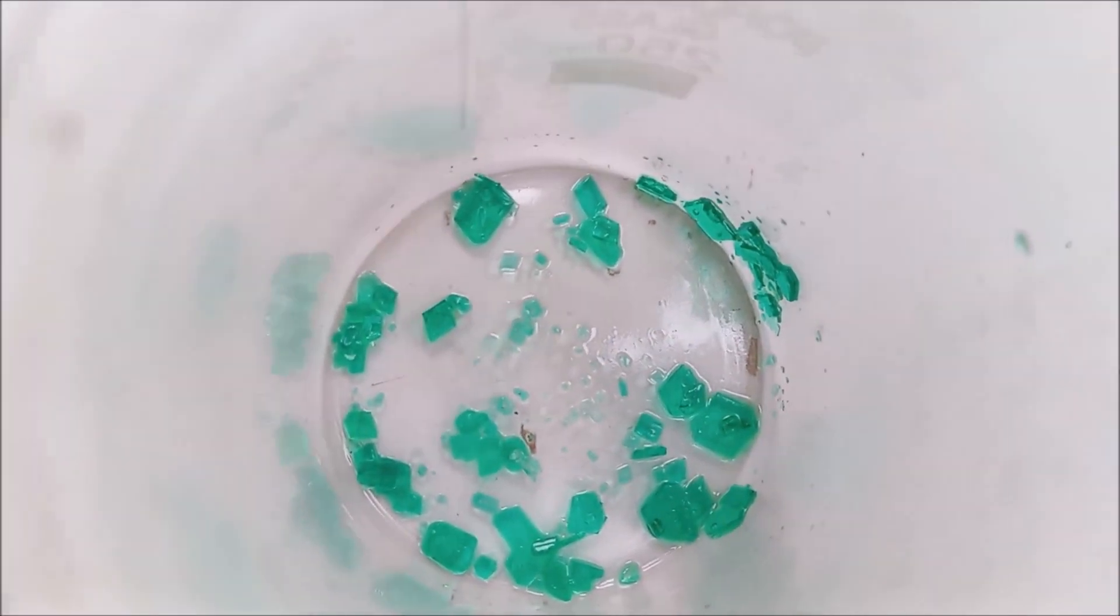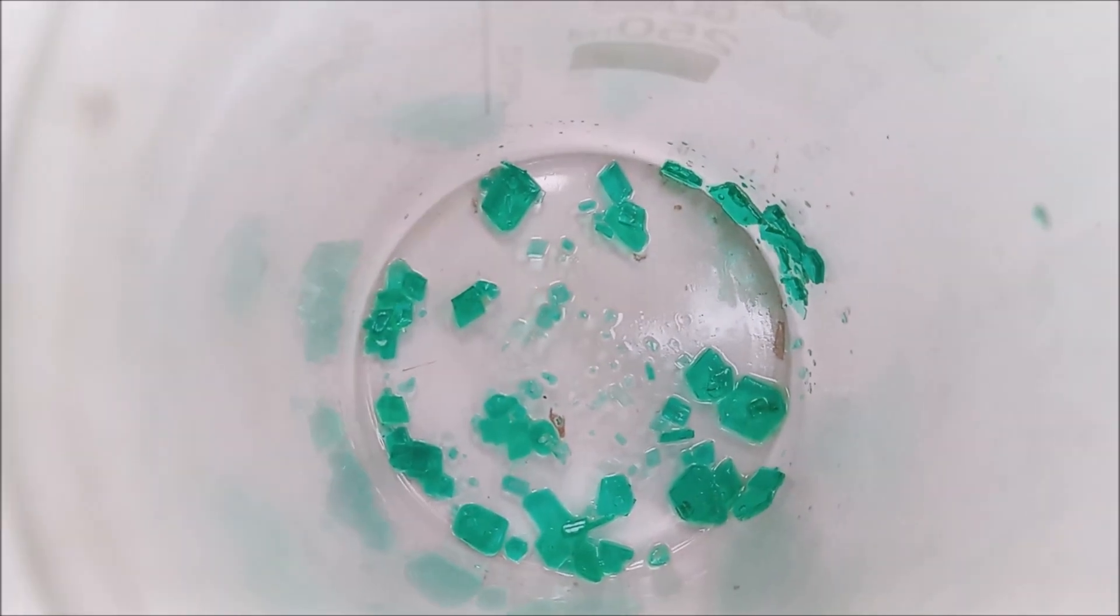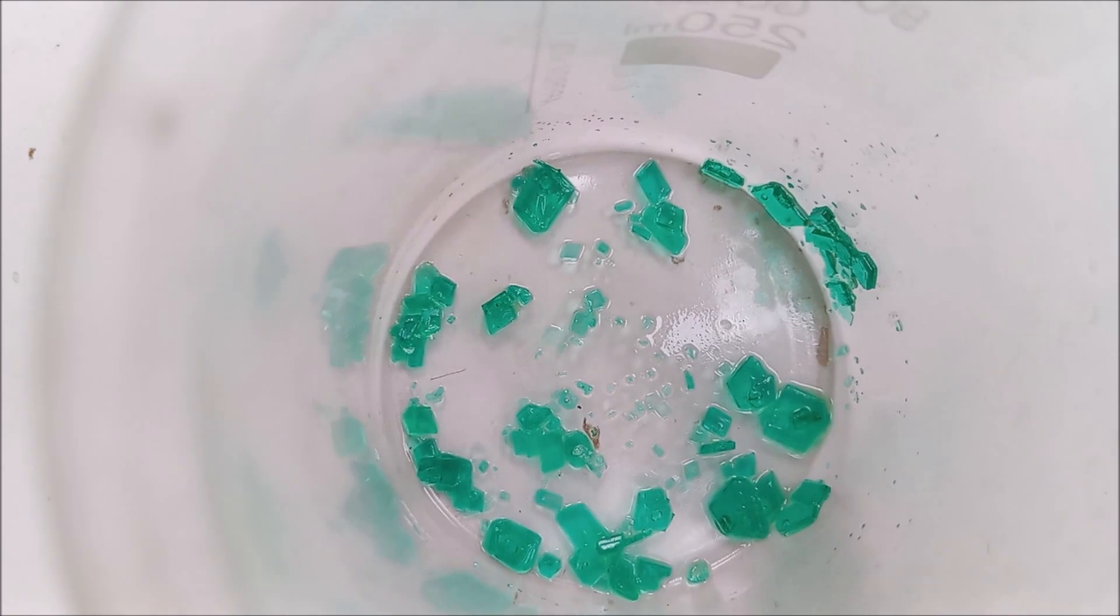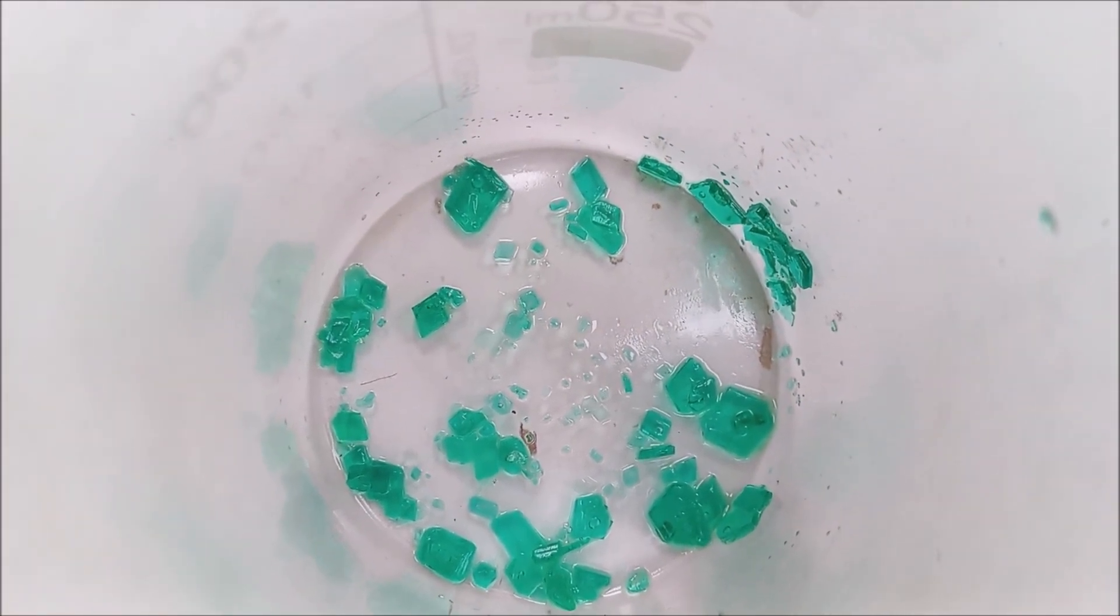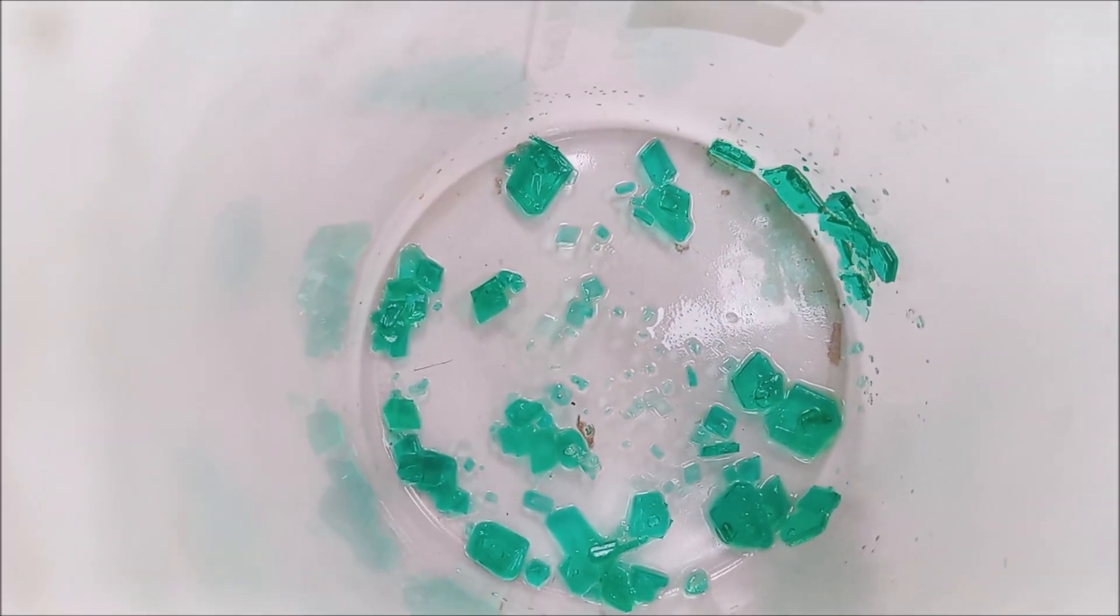On evaporating the solution at room temperature, beautiful bright green crystals of nickel sulfate heptahydrate crystallize out. It is a hygroscopic and efflorescent solid. When exposed to air, it loses a water molecule slowly and becomes hexahydrate which is blue in color.